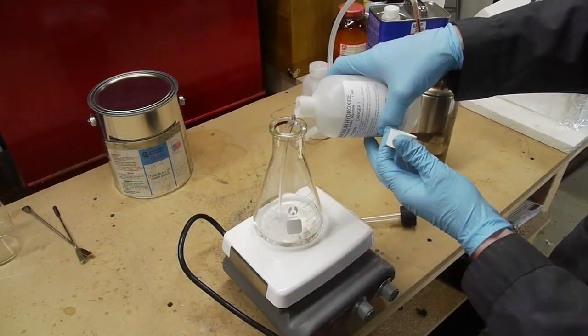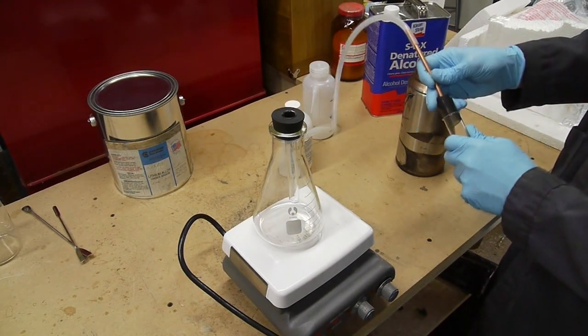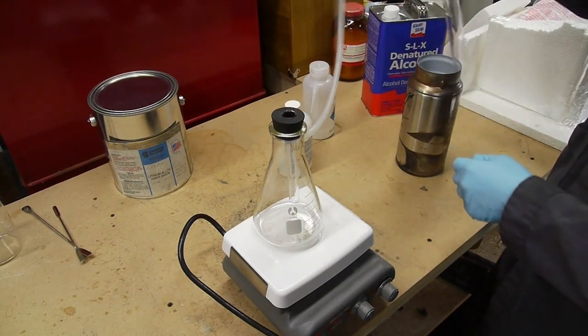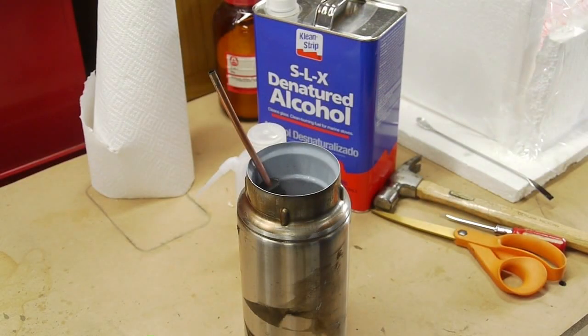And I would fill up a flask and put it on the hot plate, and then just have the ammonia gas come out of the flask, which was filled with ammonium hydroxide, and have the gas travel through the tube and then condense in the test tube.